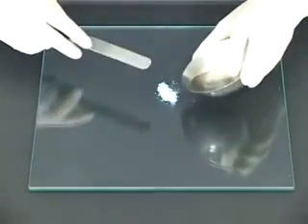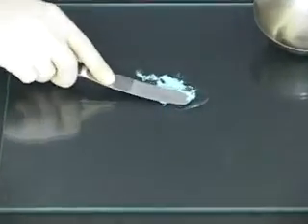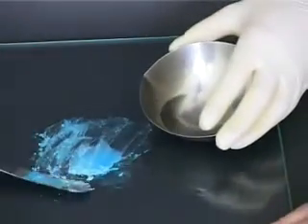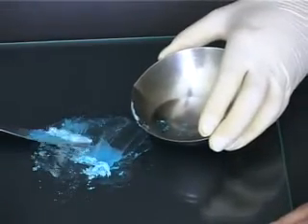A minimum amount of molten base is added to the finely ground powder already on the tile. The insoluble solid is then incorporated into the base by levigation, which is also called wet grinding. The shearing effect between the tile and the spatula will not be achieved if too much molten base is added, and the resulting product will be gritty and unpleasant to use.